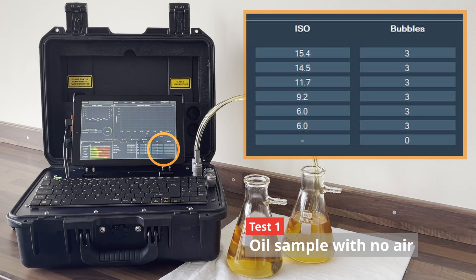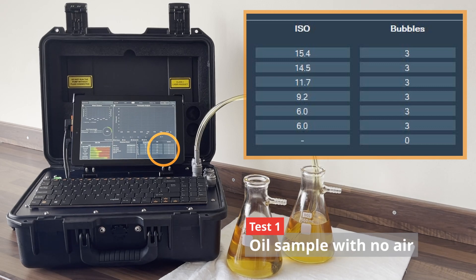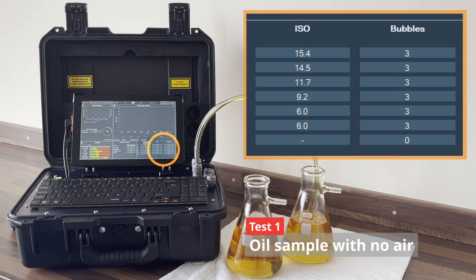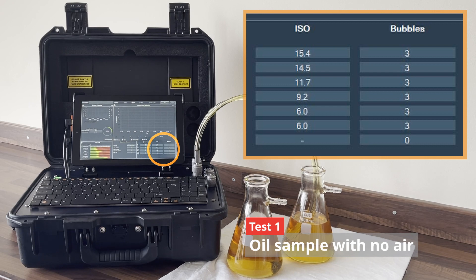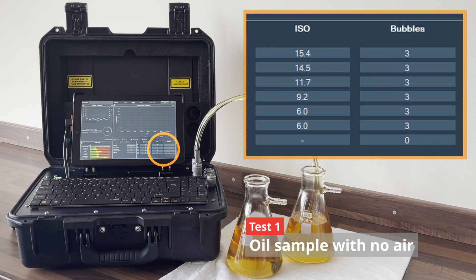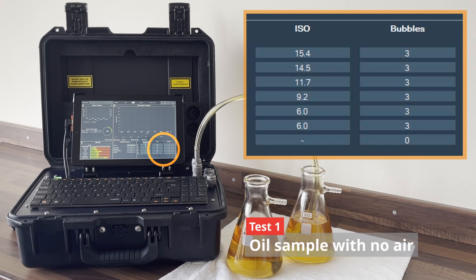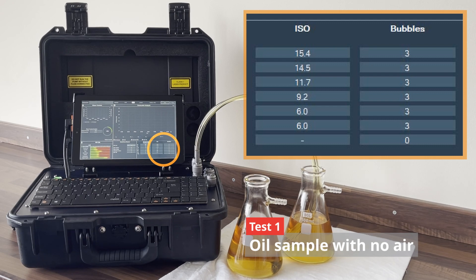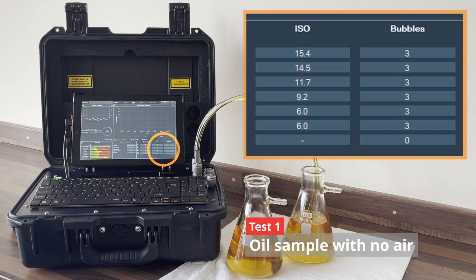So here's our first set of results. On the ISO cleanliness code we can see we're getting a result of 15, 14, 11, and there's a very minimal bubble identification on the right hand side of the display.